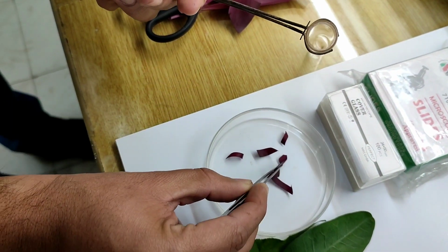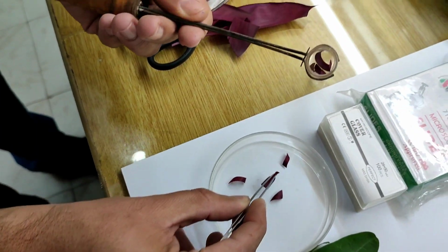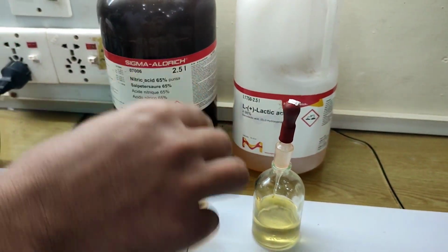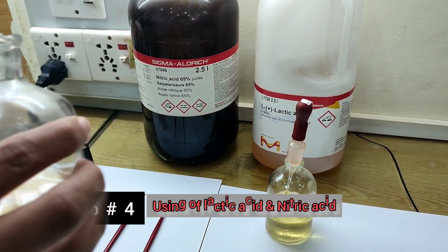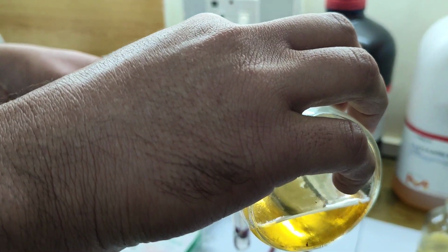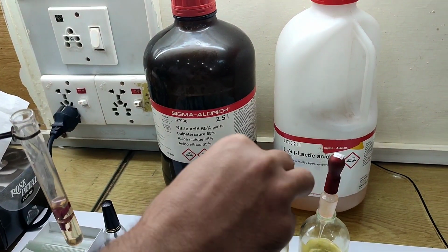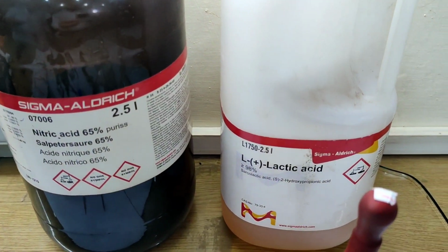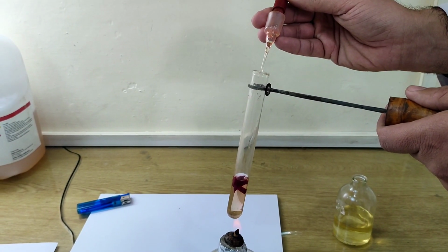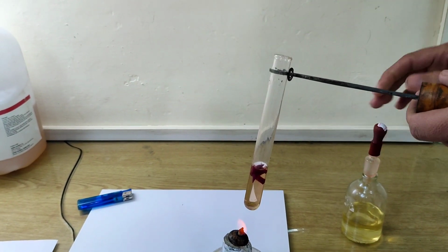Here you see the small pieces of the leaves are put into a test tube that is held by a test tube holder. The fourth step is to put lactic acid, about 75%, in a test tube. So this is the chemical that is used for leaf epidermal anatomy. Here you see it's the lactic acid. Here you see we put a few drops of nitric acid in this lactic acid solution in order to make the leaf soft and to remove the pigments of the leaf.